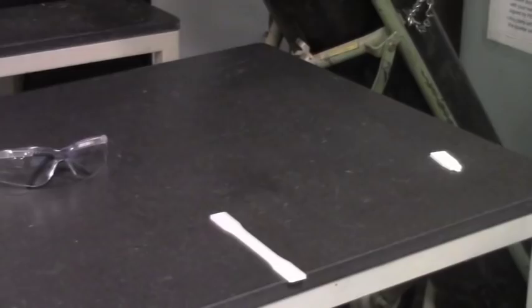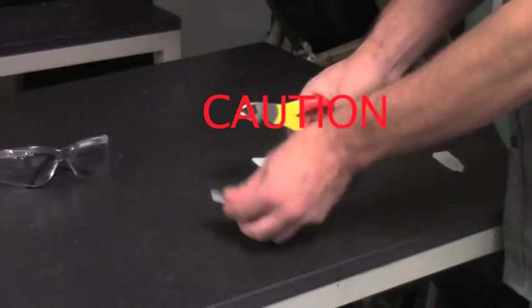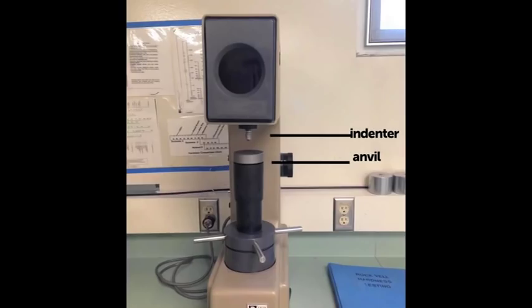Make sure to use caution when using the clippers so you do not cut yourself. We decided to trim our specimen so that no material would hang off the side of the anvil. The material, however, does need to be large enough so that the entire surface area of the indenter will fit on the workpiece.